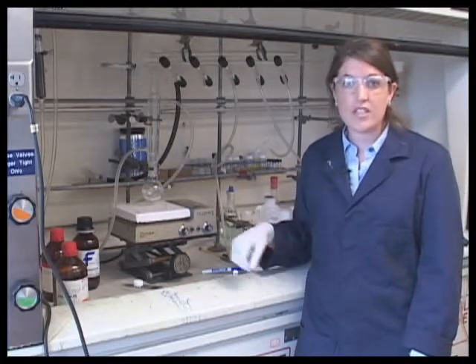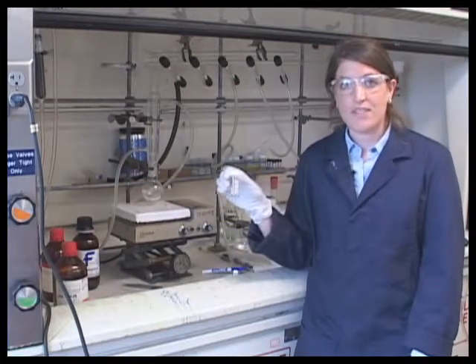For the sake of time, I'll be performing the reaction in a small vial. First, the monomer and triethylamine are mixed. This gets the monomer ready to react.